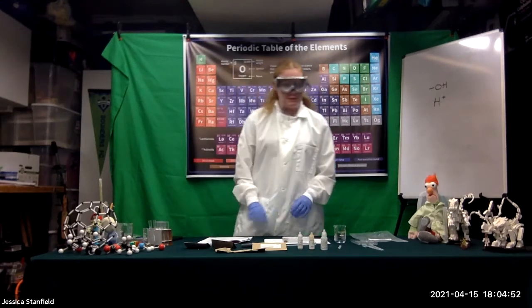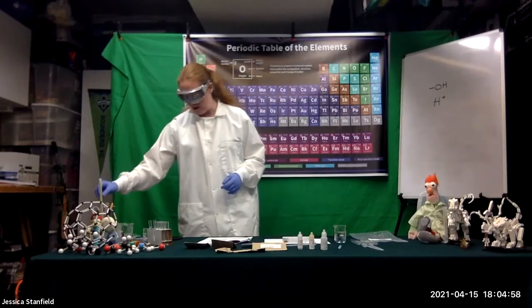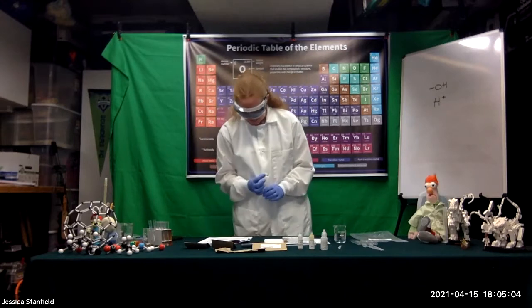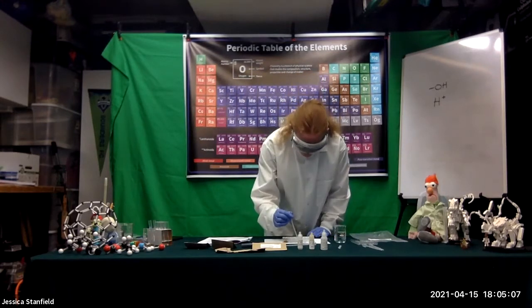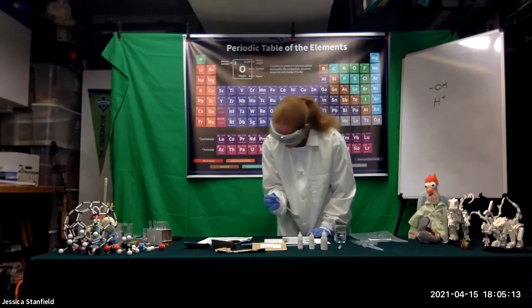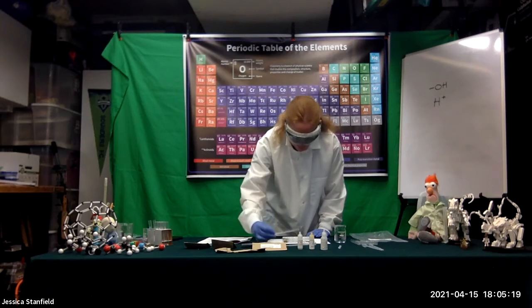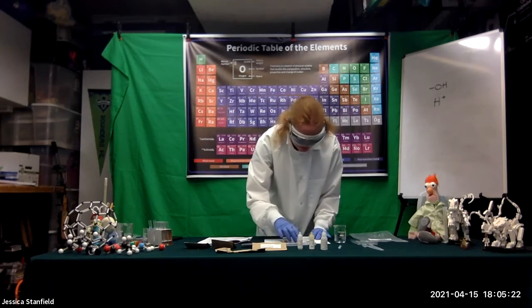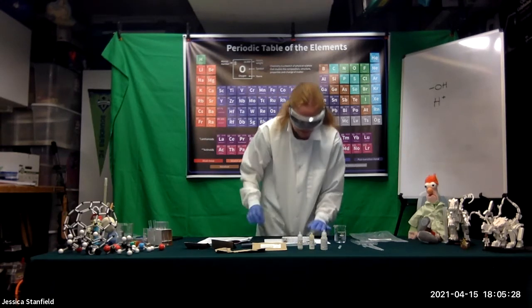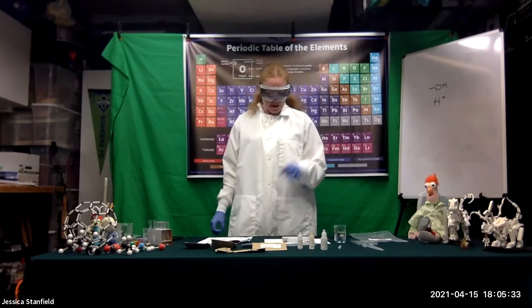We want to make sure we record our observations. Remember, when recording observations we use ink — record everything in our data table. Then I'm going to take my iron three chloride pipette and add one drop into well A1 and one drop into well A2, and record those results. You can carefully shake your well plate a little bit to make sure it all mixes together. Now we should have a bunch of different colors going on and we can record our results.